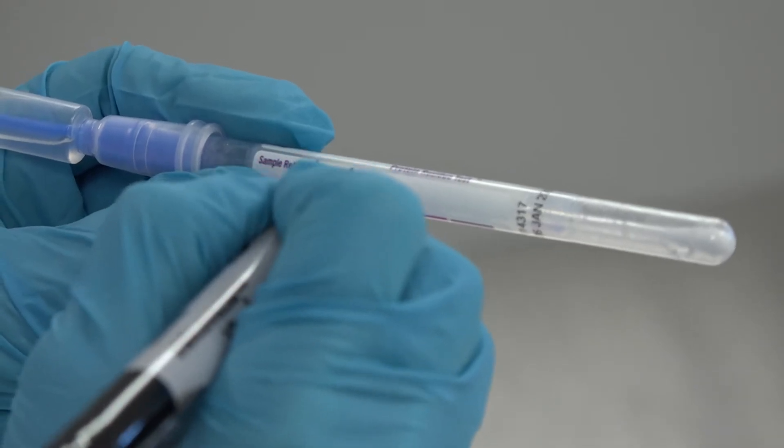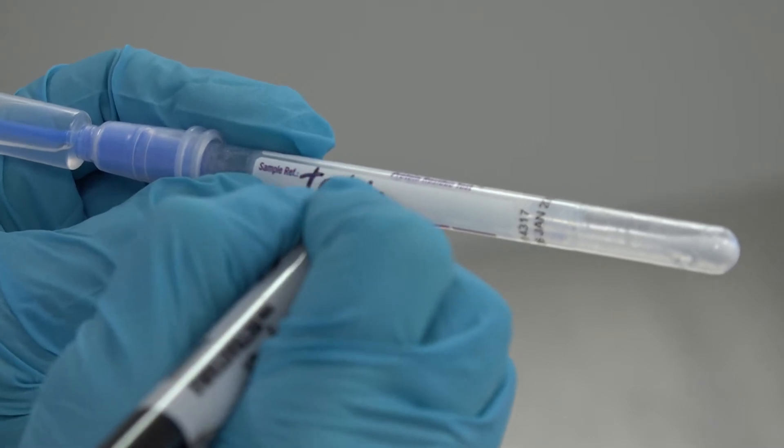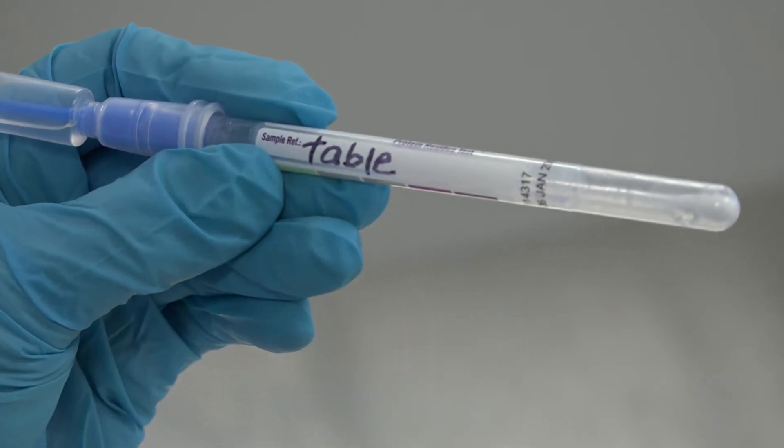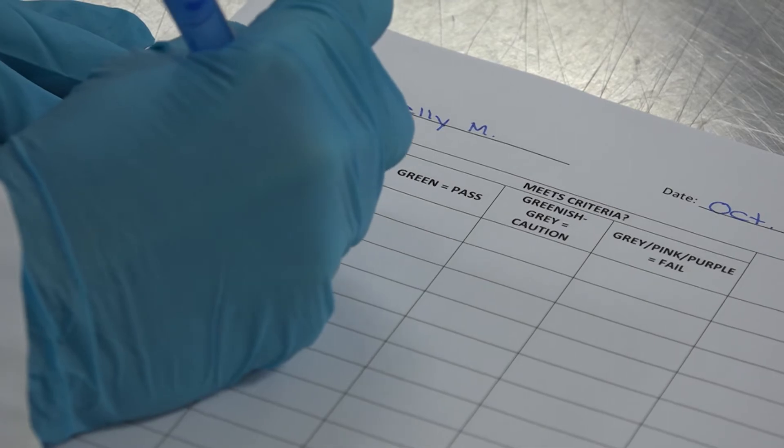Step number two, write the test location on each swab for identification purposes and record on the monitoring record.